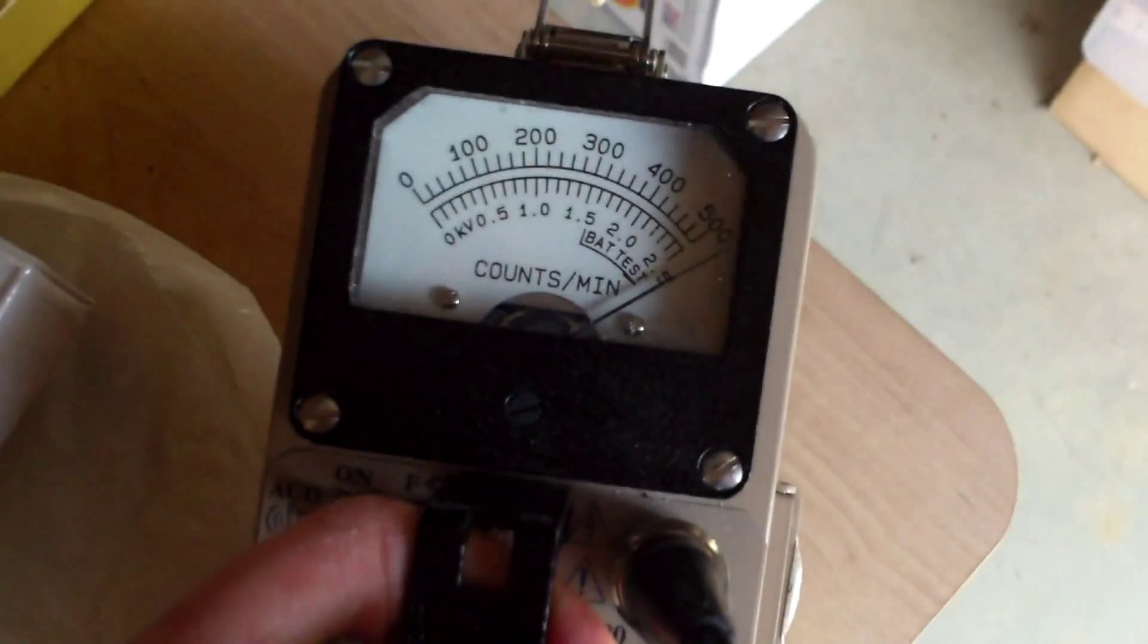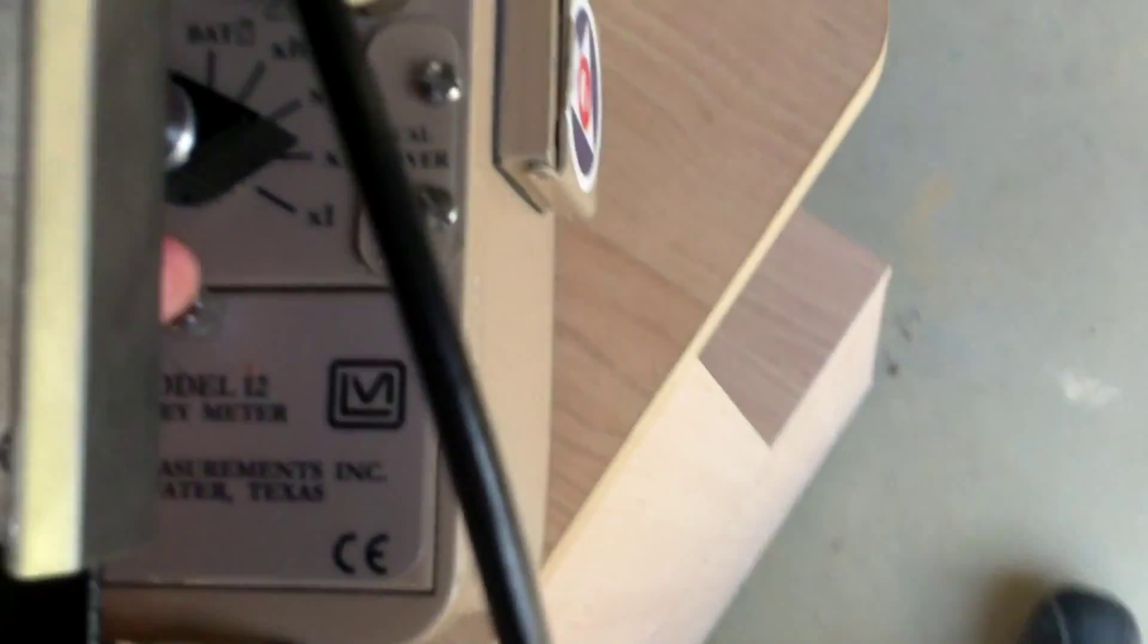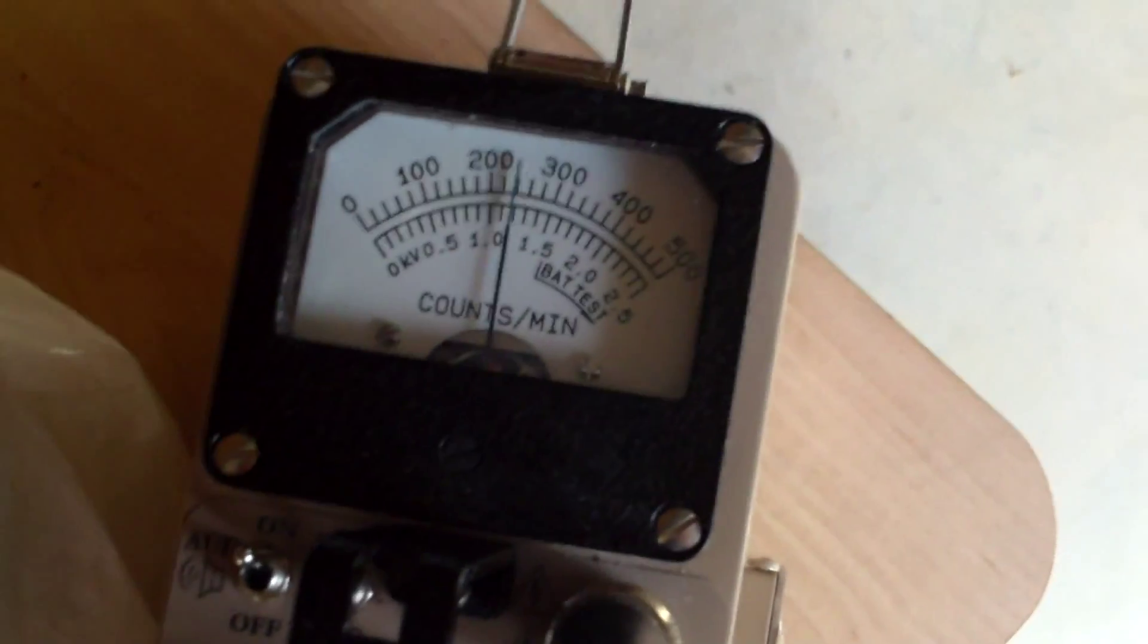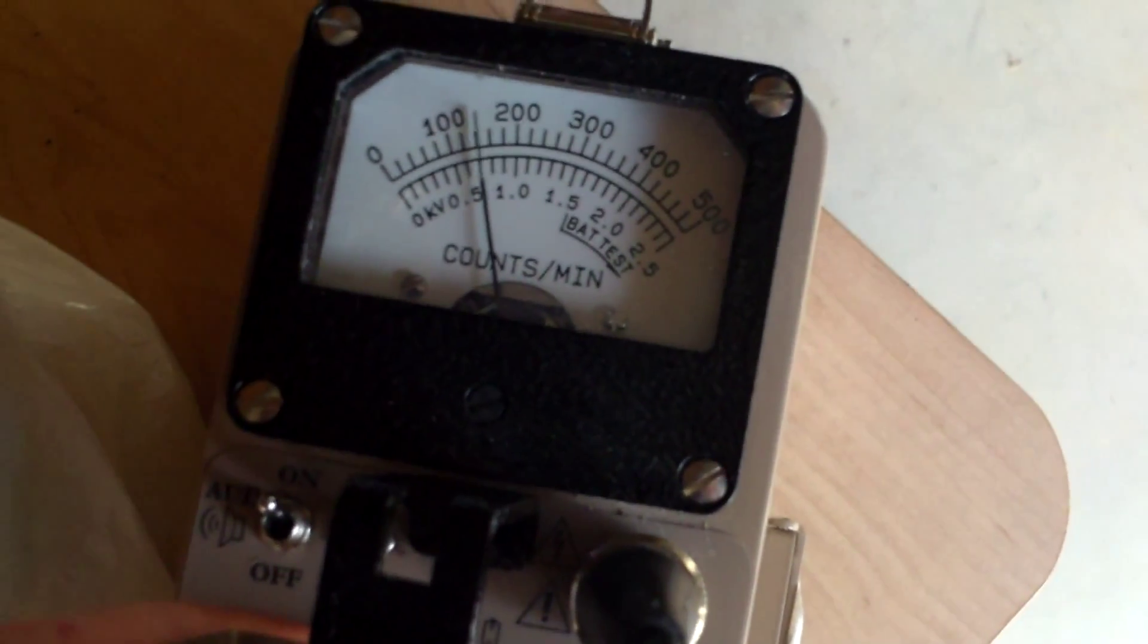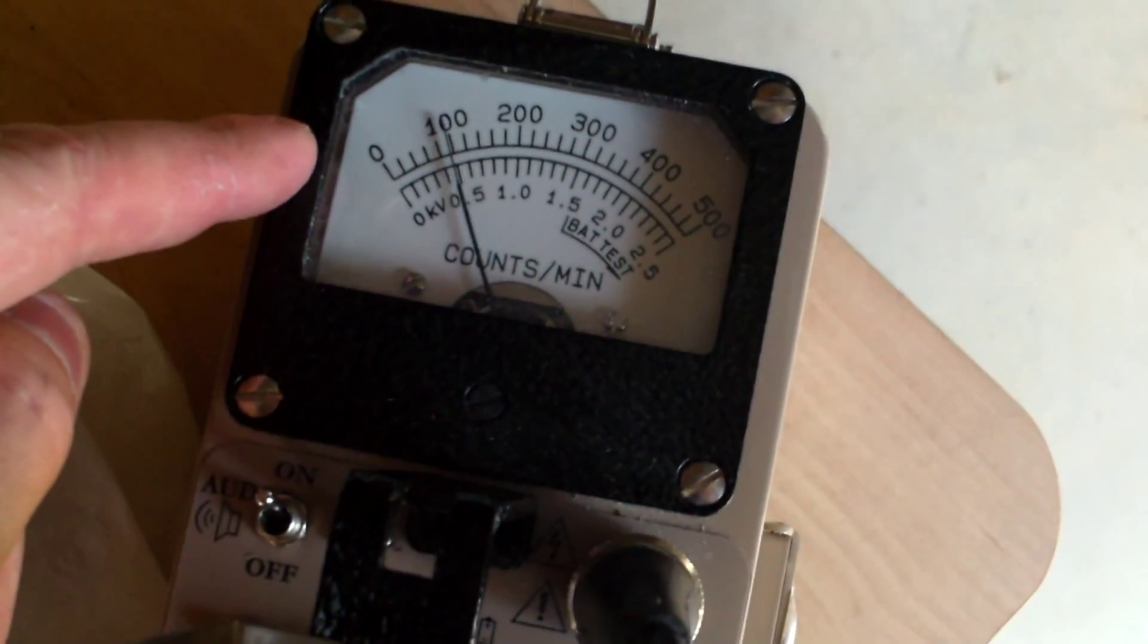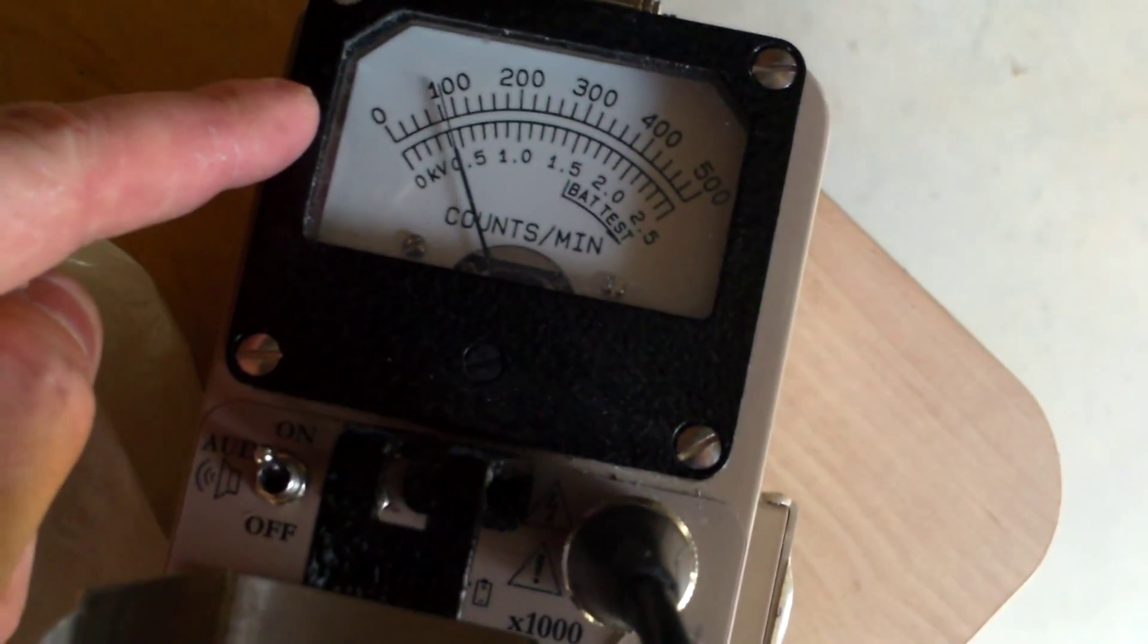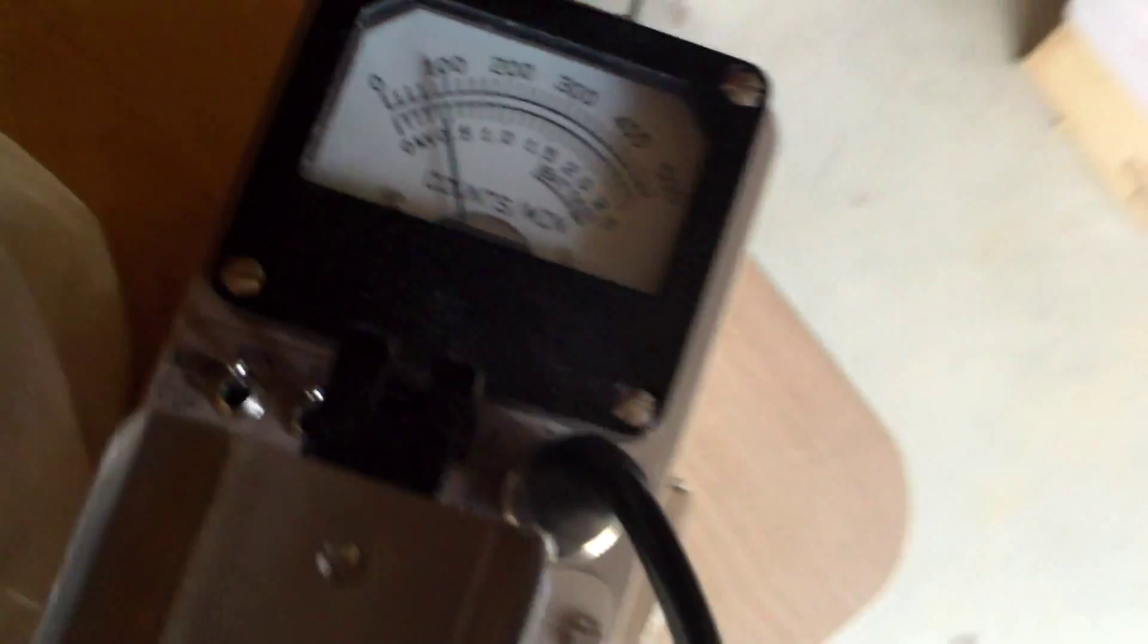So, not only am I below them, but I'm also far away from them. And we're hard over on my Ludlum on the x10 mode, which is normally around 2,000 counts per minute, and I'm way over that. Switch to 100 times. And let's drop down and see where we go.